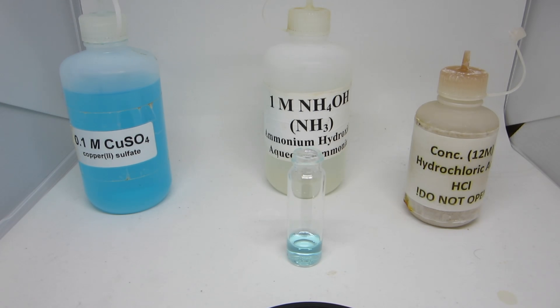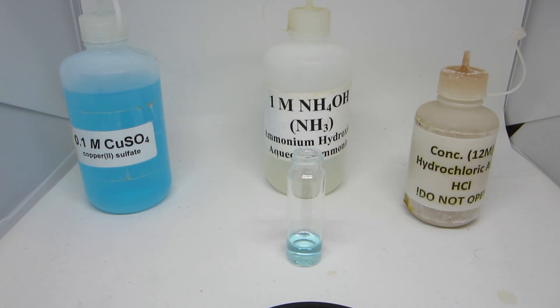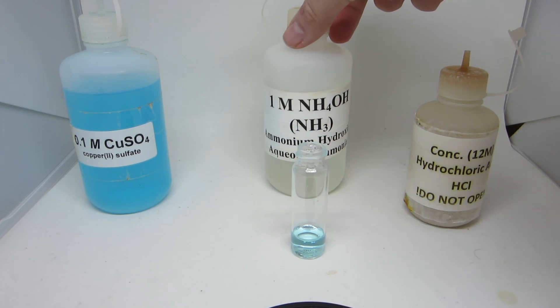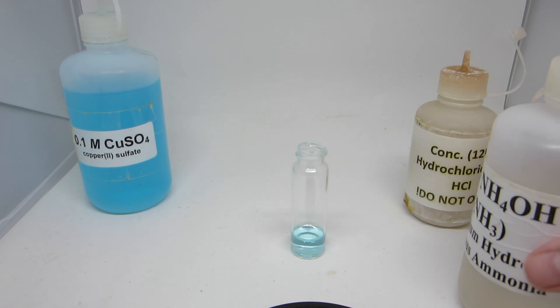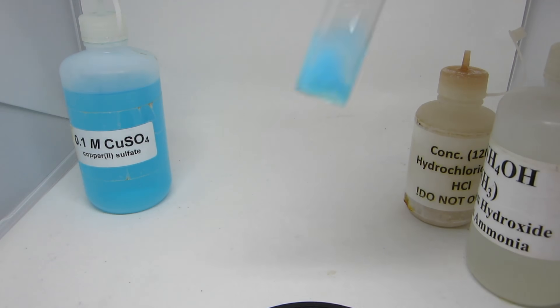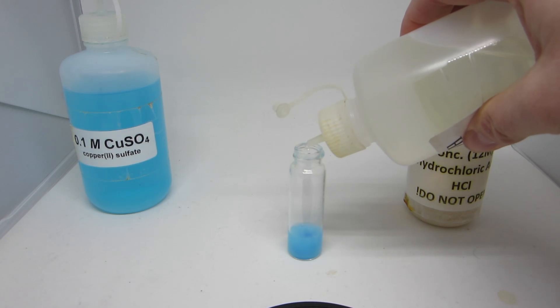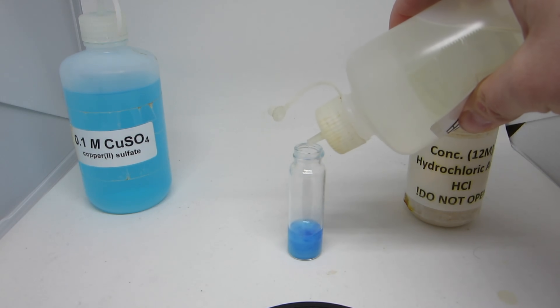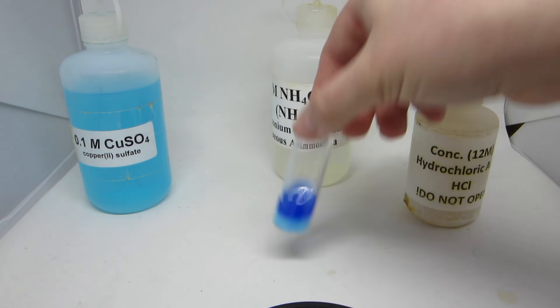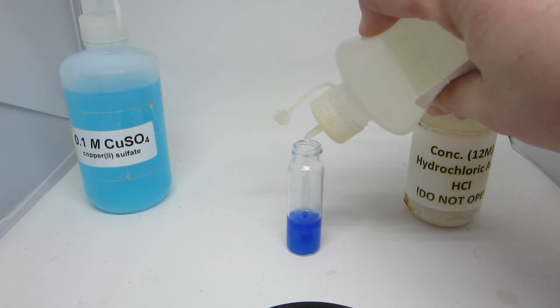In the last reaction, number 12, you are looking at the different complexation steps with the copper ion. Starting with a light blue copper sulfate solution, upon addition of a small amount of ammonium hydroxide, you can see the formation of a darker blue precipitate. With continued addition of ammonium hydroxide, the hydroxide ions are being displaced by the aqueous ammonia NH₃ ions, which cause the precipitate to dissolve and the formation of a dark blue clear solution.